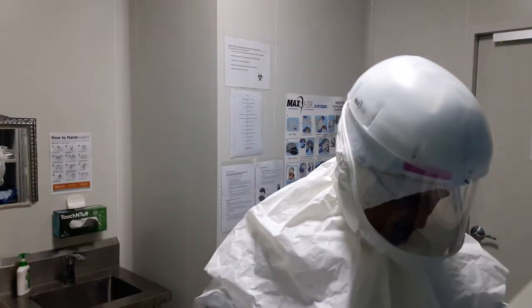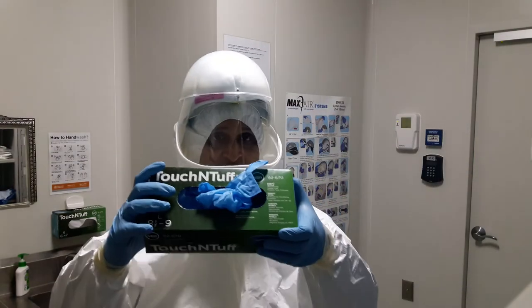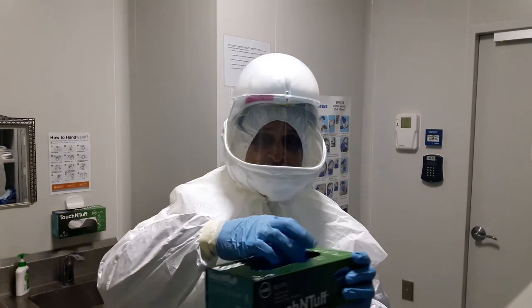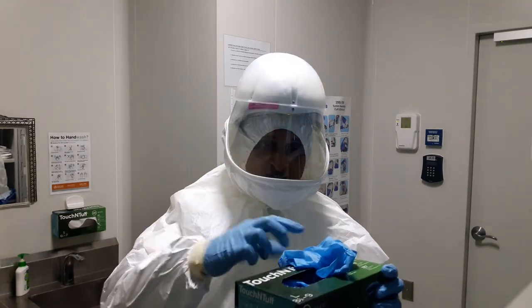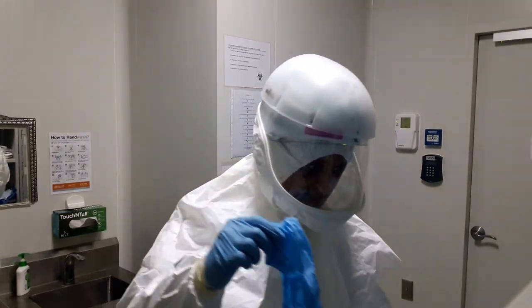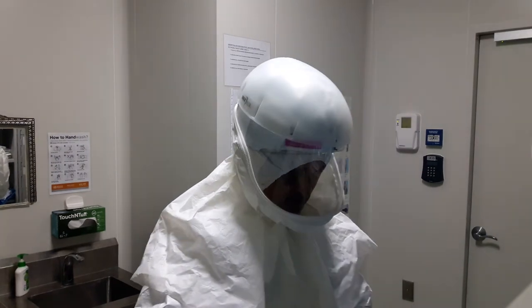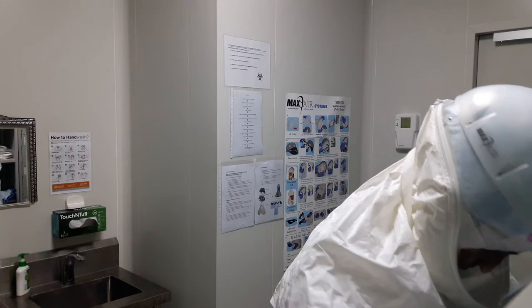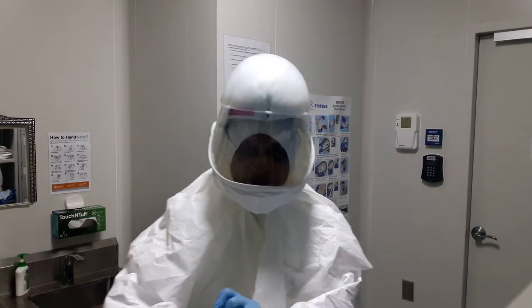As a precaution, I have to wear another set of gloves — so these are double gloves. I am going to wear this glove over my existing glove, so that in case of a spill I can discard the outer glove. So I now have a double glove.